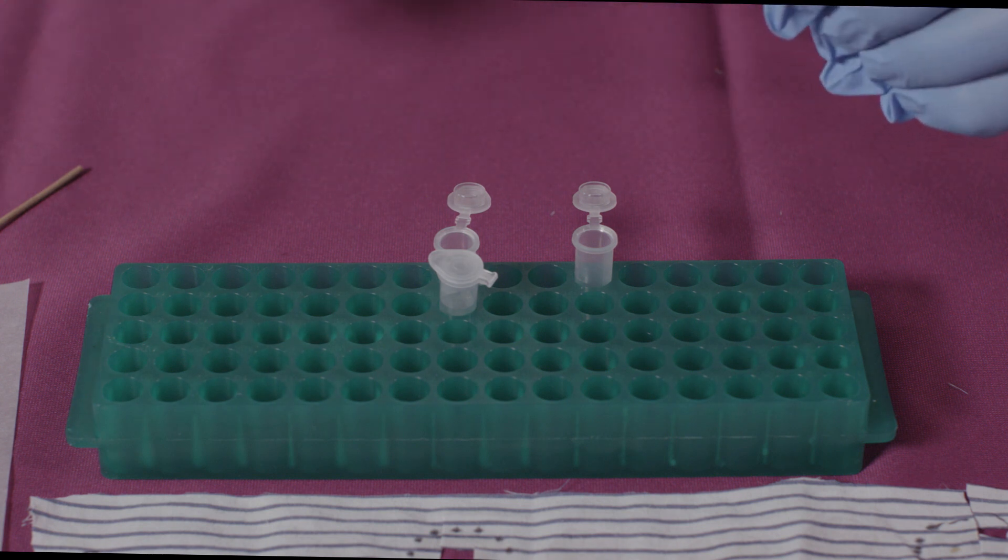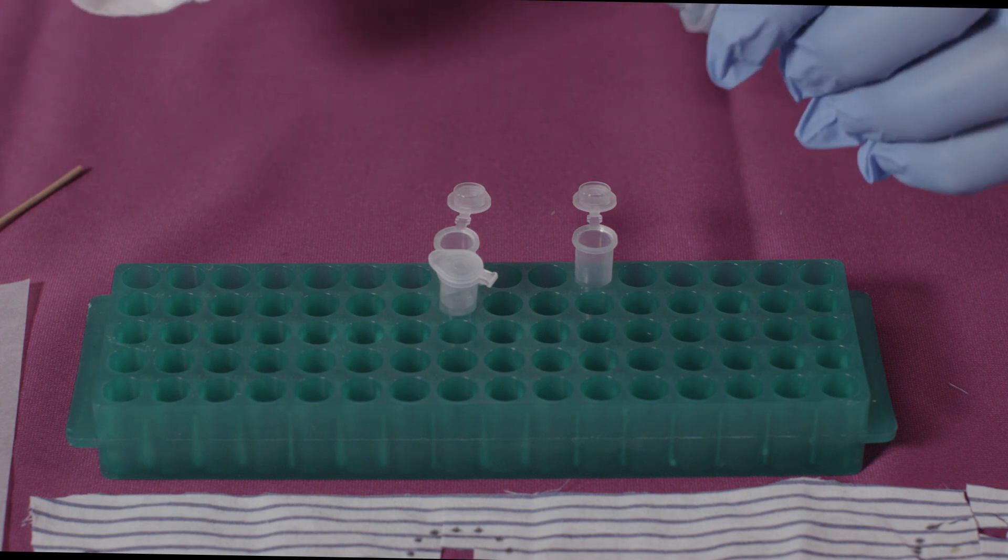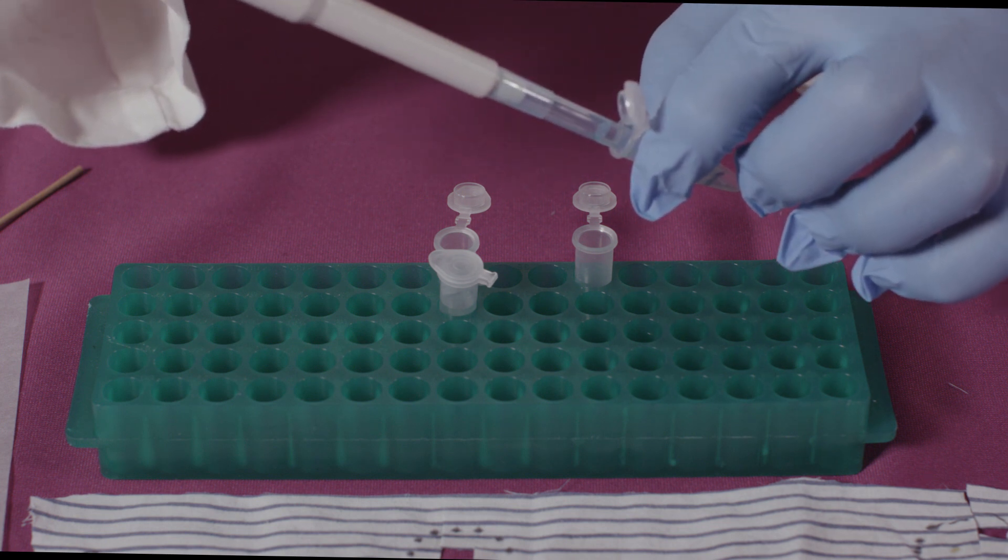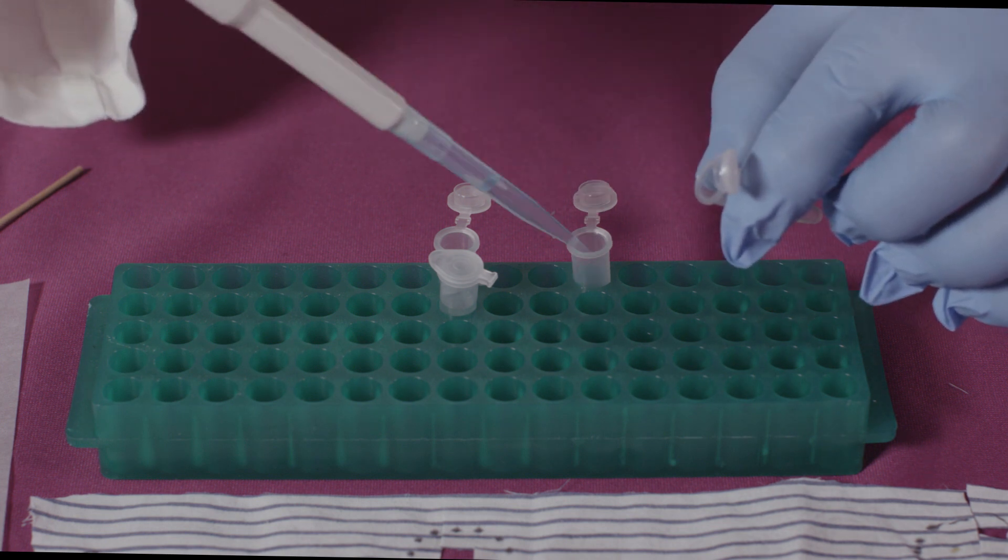Carefully transfer most of the buffer to another labeled microfuge tube and retain for PSA analysis.